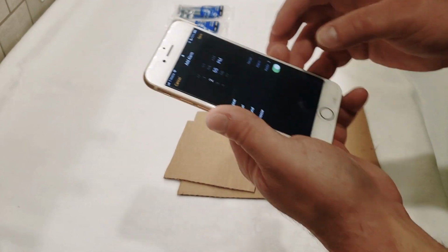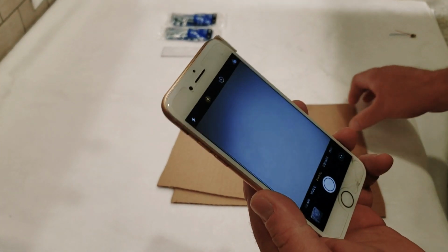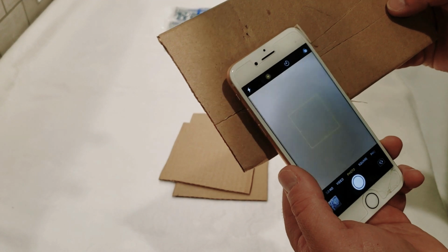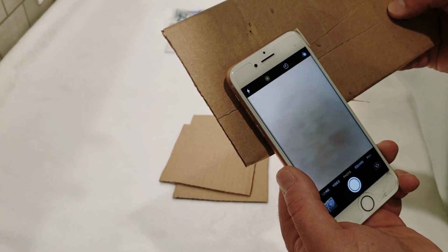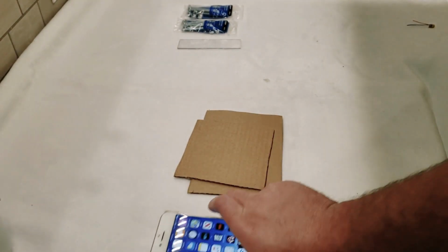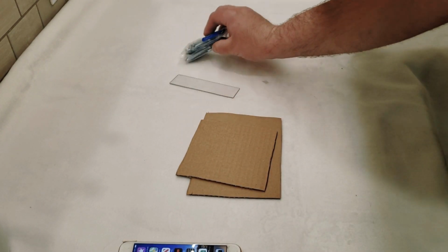There we go, and if you can see, if we open the camera, it's kind of fuzzy. But if we hold something up to it, if we get just the right distance right there, we can kind of see the fibers. And now we just need to make something to hold it. And that is where all of this is going to come in.